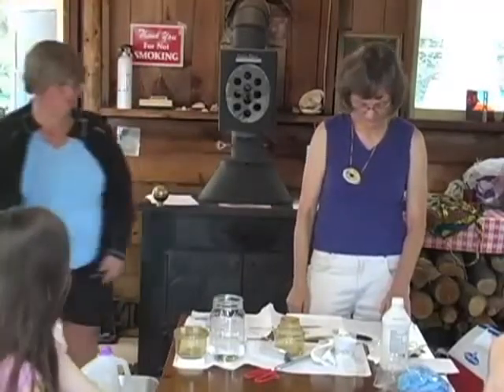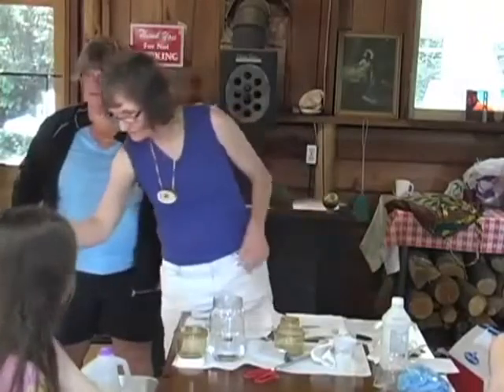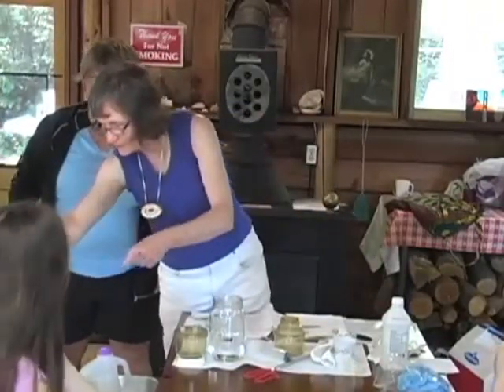Invert the test as you put it in the incubator. This allows condensation to rise. Okay, so somebody want to set this on the shelf or in the incubator? You just set it right in the little oven. Incubate for 24 hours, plus or minus 2. Now, we may not be here 24 hours, but anybody that wants to look in the morning, you should be able to see some bacteria.